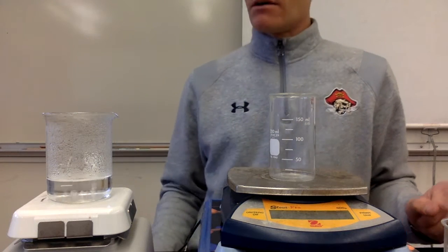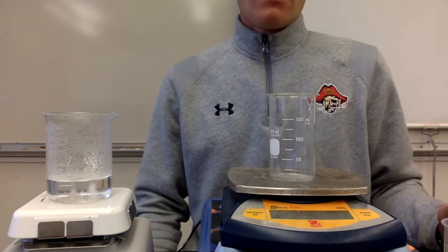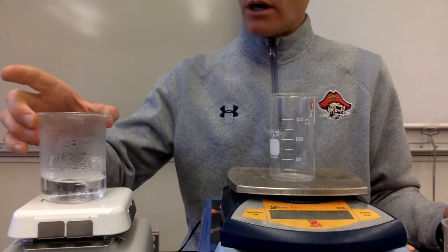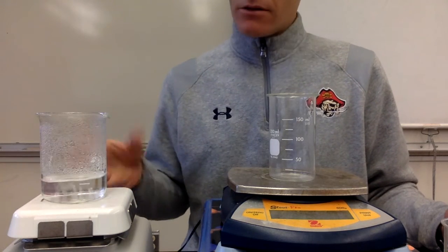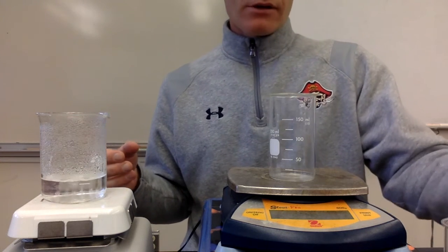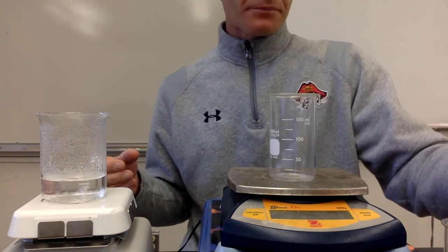What's up, guys? This video is going to be for finding the heat of vaporization of water. So right here I have some water that is just boiling. So it's at 100 degrees and it's just started to boil. And then I also have some cold water over here.